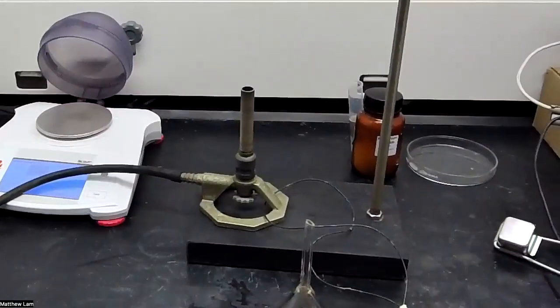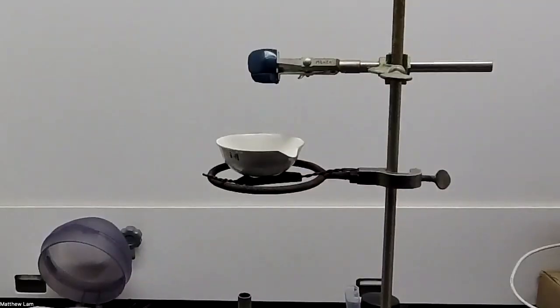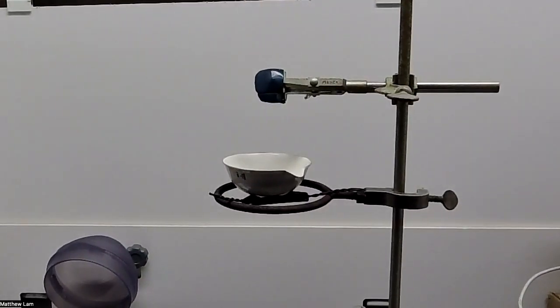That is our setup with our Bunsen burner on the bottom up to the evaporating dish on the top. The evaporating dish is going to hold our ammonium chloride for this experiment. So let's start off with the procedure.